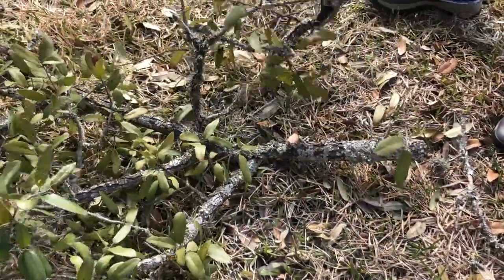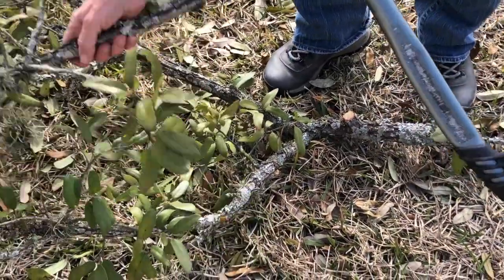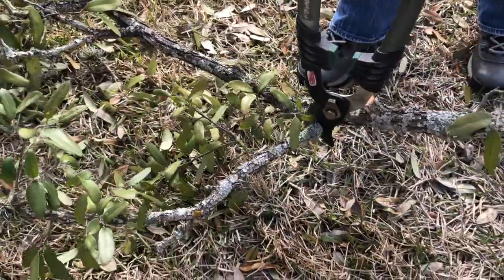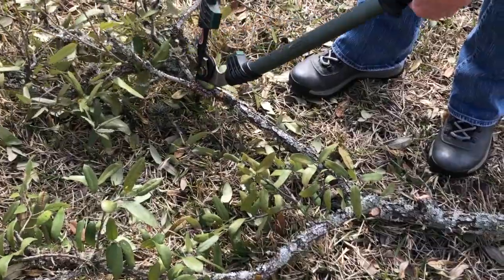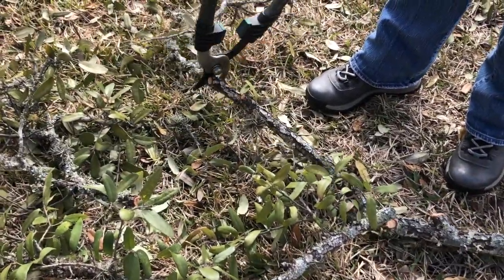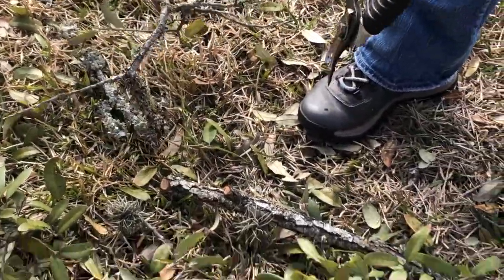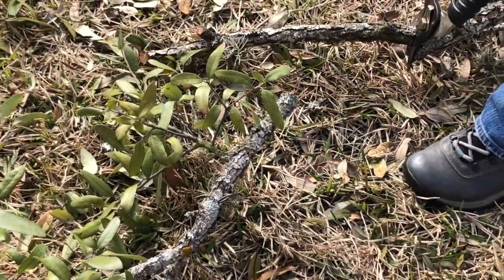As you can see, the main branch there is about an inch, inch and a half in diameter, and it has some laterals on there that might also be useful. She's going to go ahead and remove those down to about an inch, three quarters of an inch. This is going to form the bulk of the sample that would be suitable for submission to the laboratory. She's going to cut it up into sections eight to ten inches long.